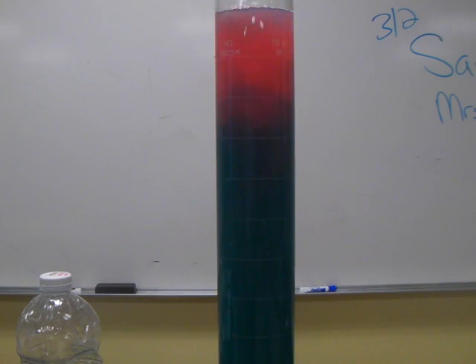Of course, at some point in time we'll run out of excess hydroxide ions and it will no longer buffer, and if we continue to add acid, then the pH would drop and it would stay much lower than it is now. You can see it's rebounded again. Looks like we have enough to make another addition here.